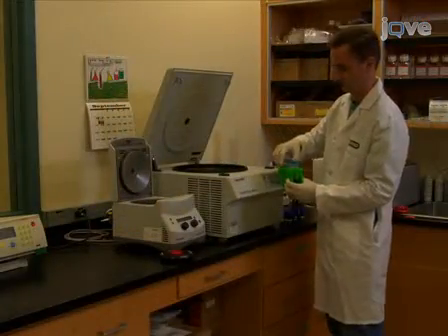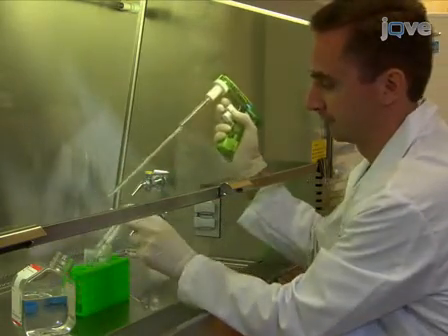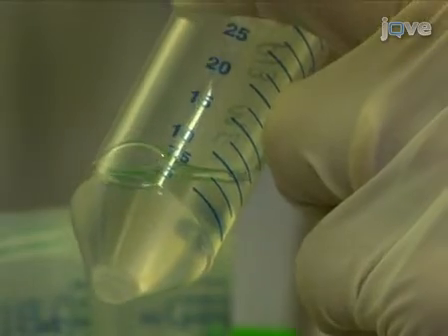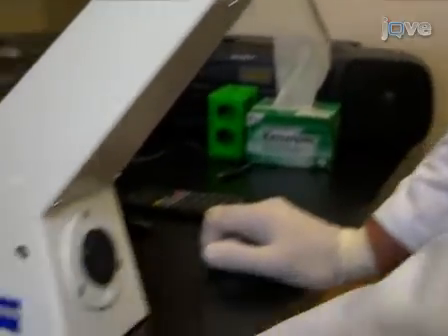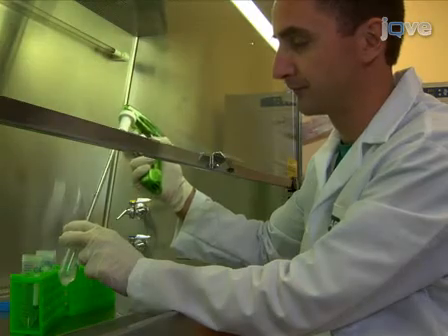Once collected, centrifuge the cells. After the cells have been pelleted, they should be washed by resuspending them in a known volume of PBS. Once fully resuspended, count the cells. Knowing that a concentration of 1 million cells per milliliter will be needed for electroporation experiments, calculate the appropriate number of cells based on the cell count, and transfer them to a clean tube.